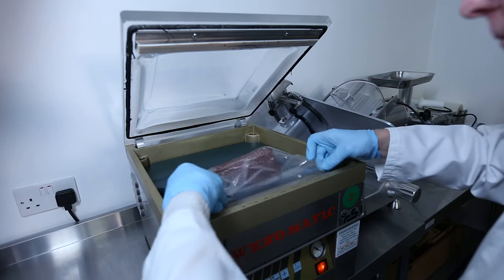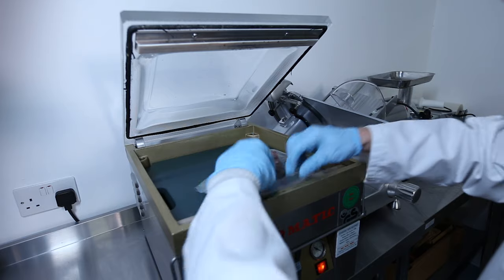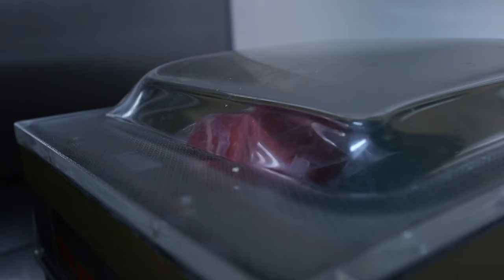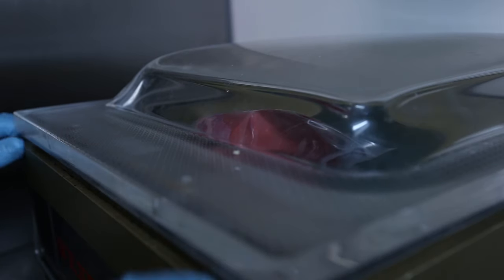Most shear force tests are carried out on cooked samples to simulate how the consumer would treat meat in the home. When preparing your samples for cooking, make sure they are a similar size and clearly labelled.